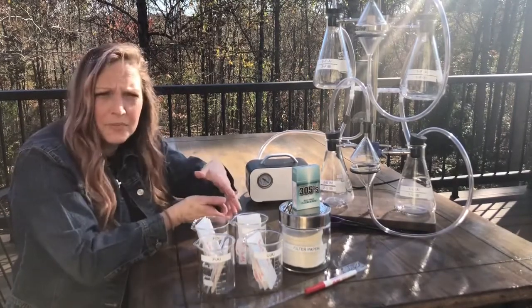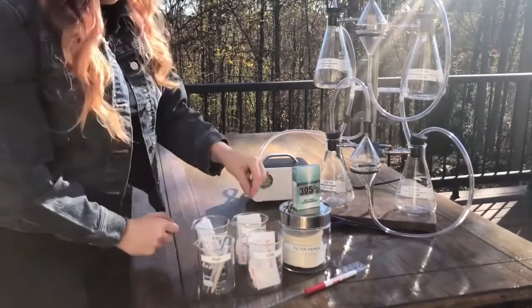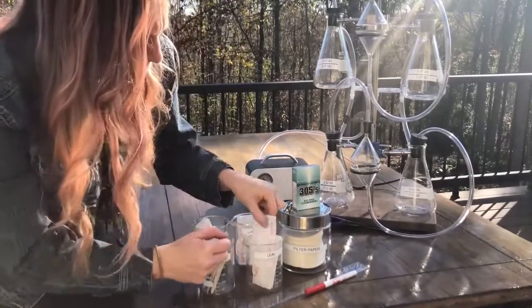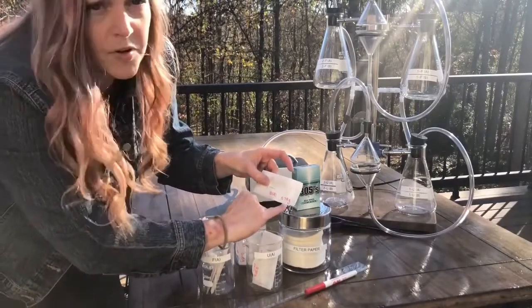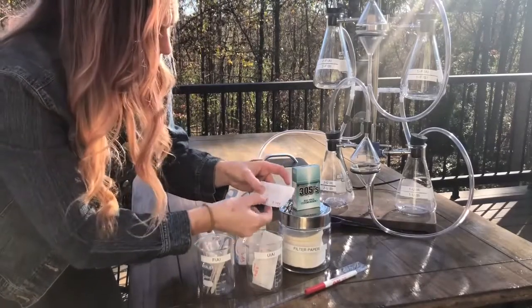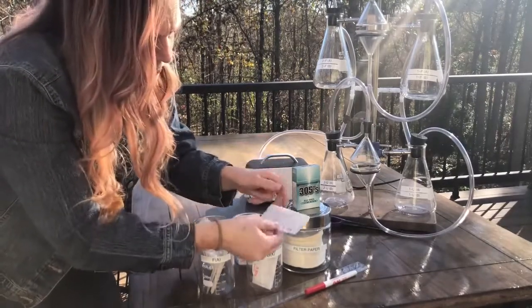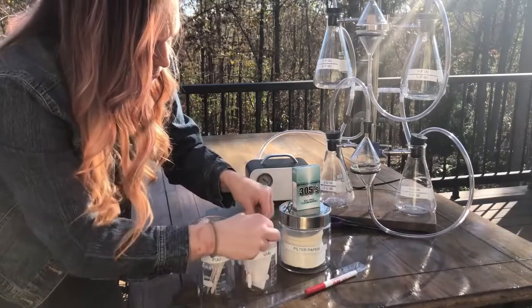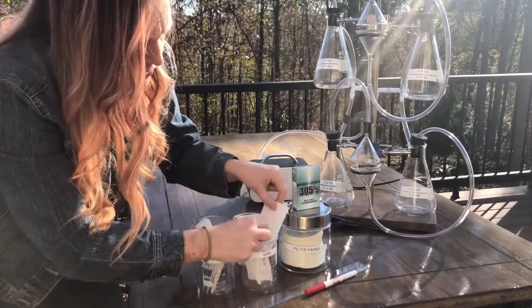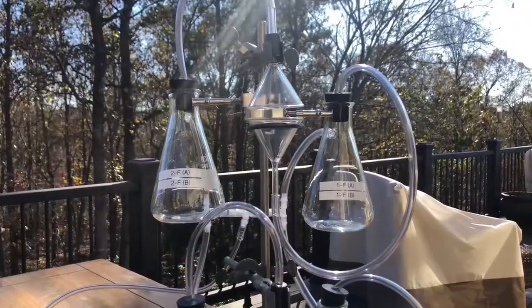I want to show you what we have in the beakers first so you know what we're using. So, first things first. This contains our unfiltered cigarette, and I have pre-massed everything so that we can just get the mass after we've run the experiment. Each of these beakers contains, like this one's an unfiltered cigarette, there's the mass on it. And then these are 2 filters, and it's the same for each one.